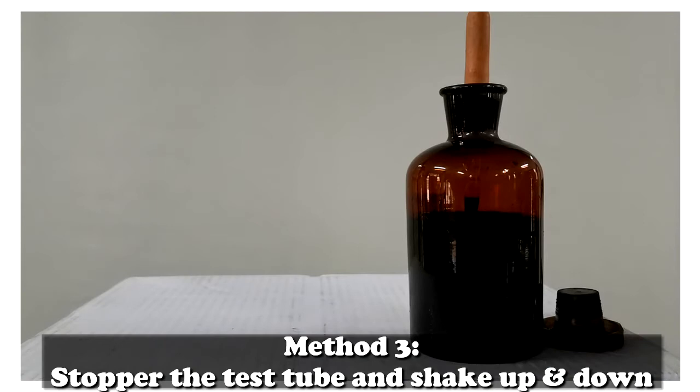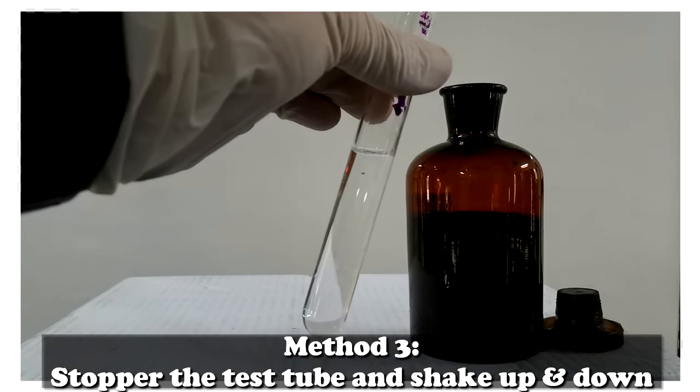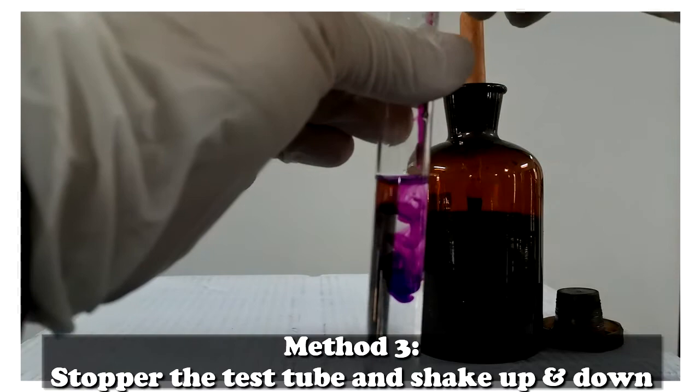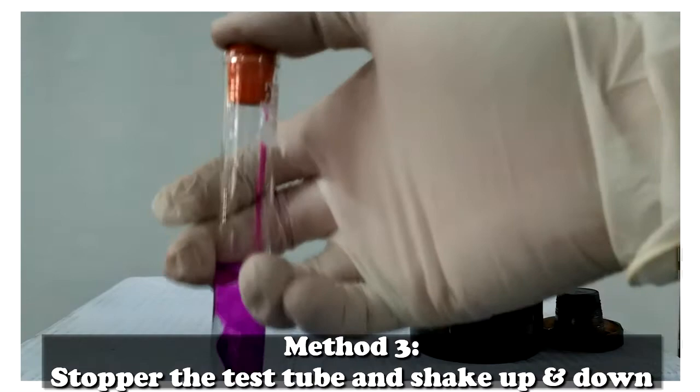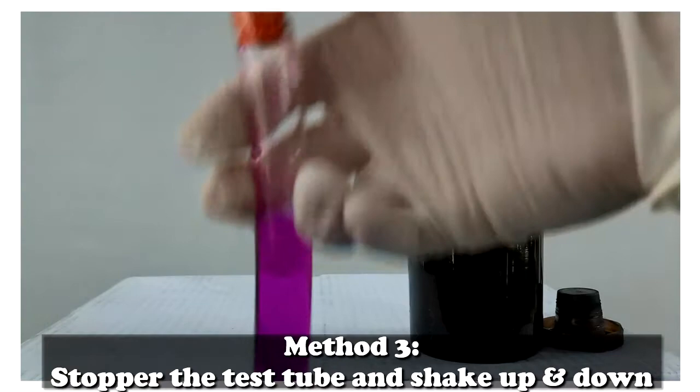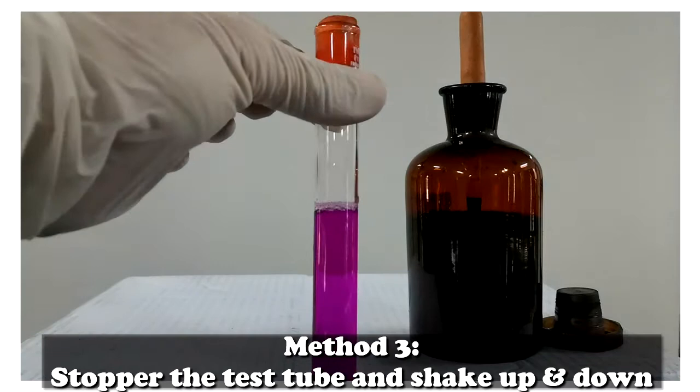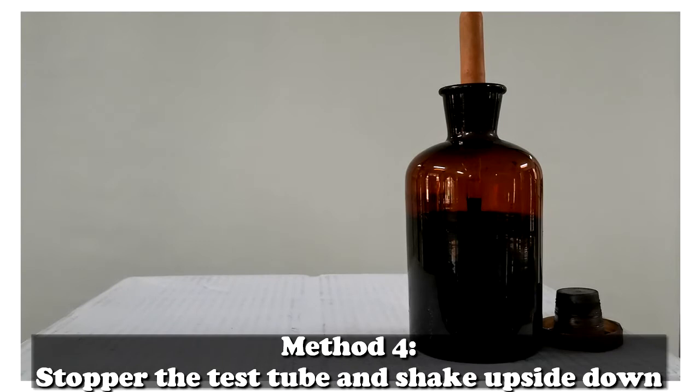Method 3: Stopper the test tubes and shake up and down. Method 4: Stopper the test tube and shake upside down.